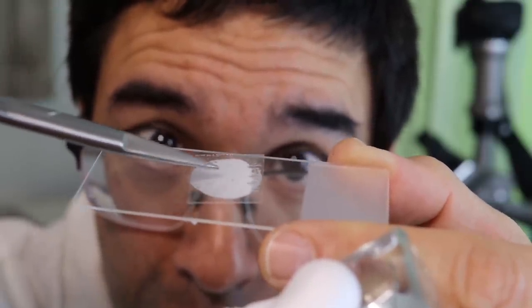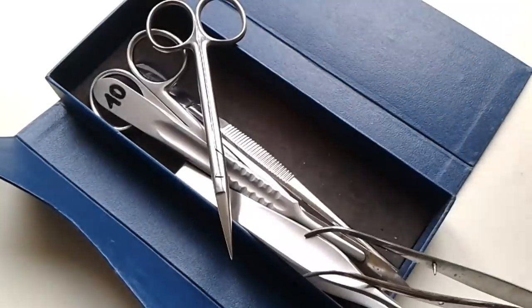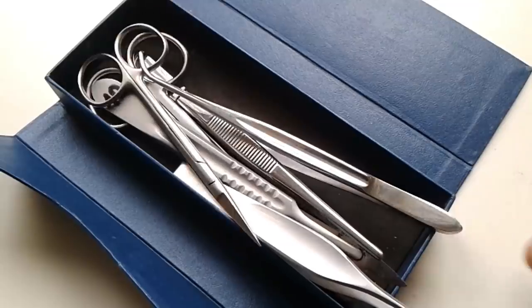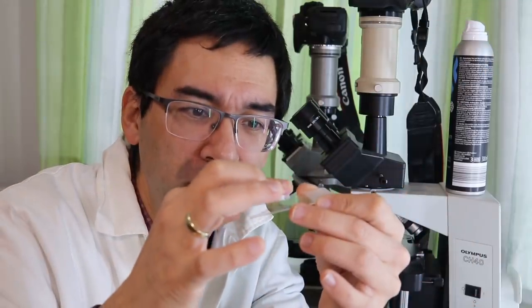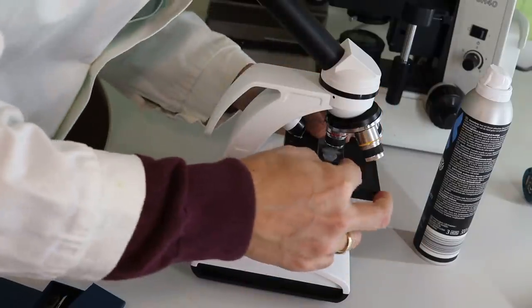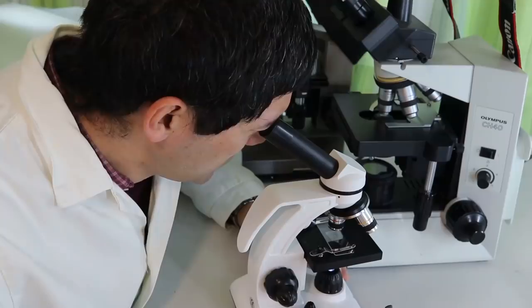But if you really want to be cool and want to give a very professional appearance, then you don't want to use these tools. All you do is the following: you grab a little bit of foam, you put it on the slide, and you put the cover glass on it like this and you'll be fine. And then of course everything goes under the microscope.